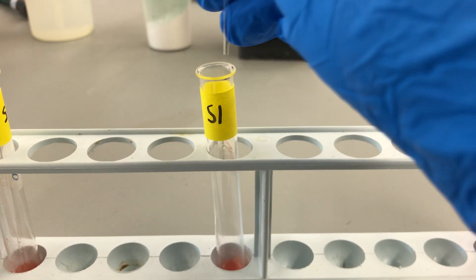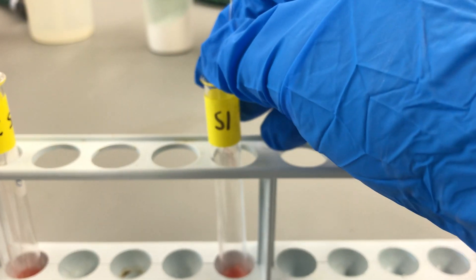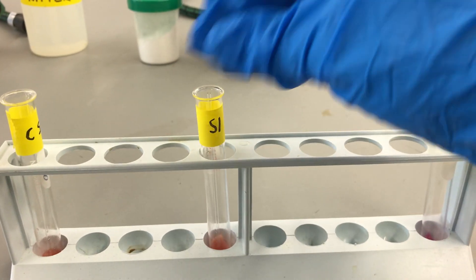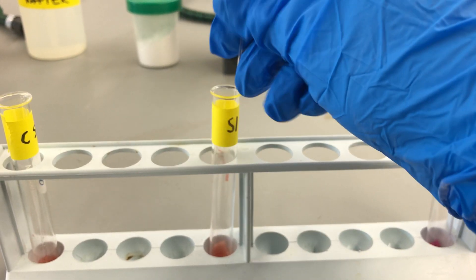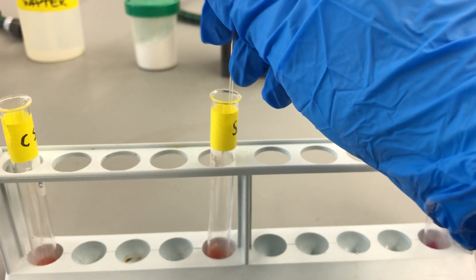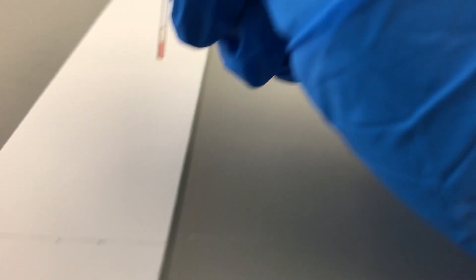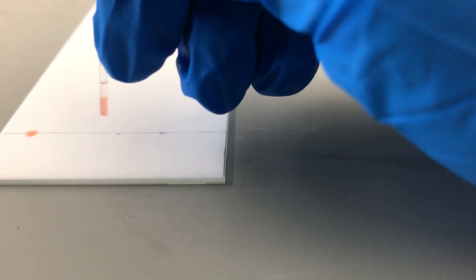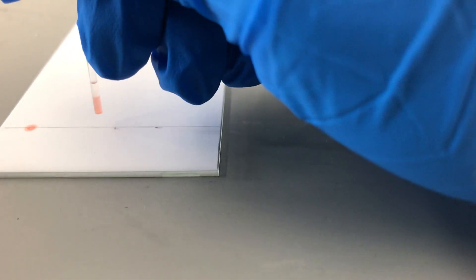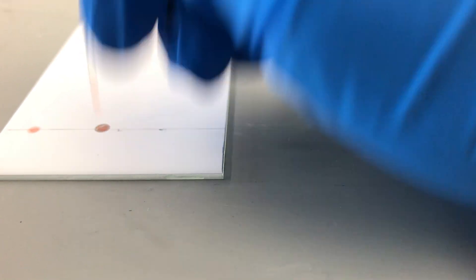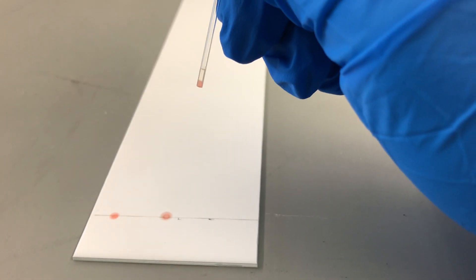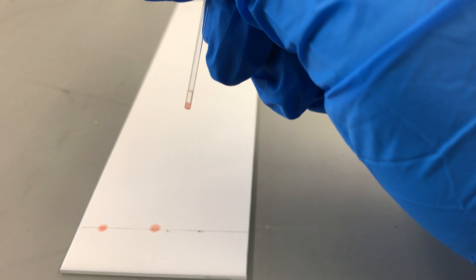So a separate tube for each. Let's just insert it and we're going to dot it exactly on the same line, like so, essentially in the middle. Same sort of thing, just very gently touch it to the line.